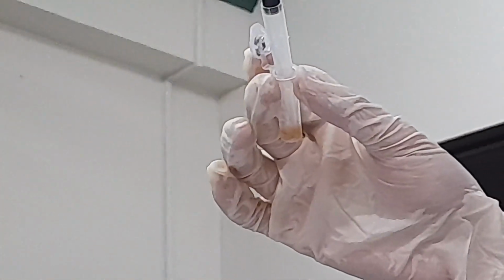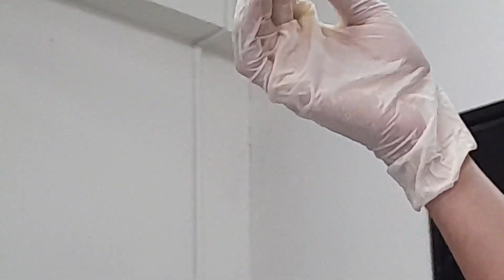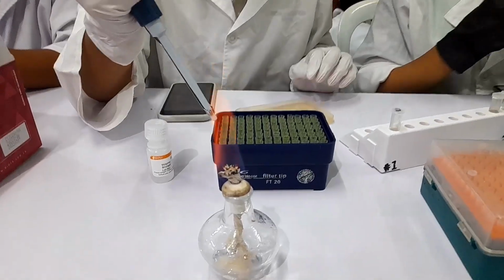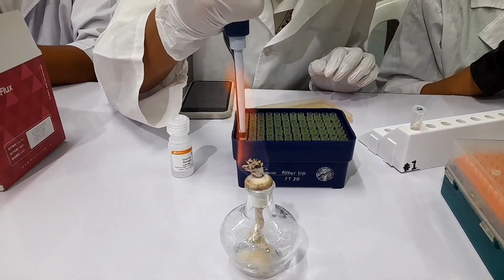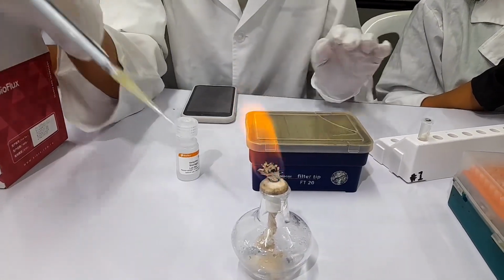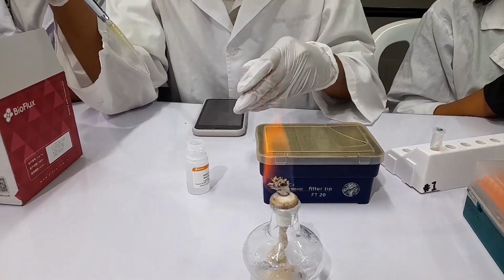You take a little more out, but just be very conservative. Okay. Yeah. It's okay. I would leave that there. Again, you don't have to take out all the liquid. Yeah, and then cover the thing. Try not to touch the inside of the lid because I saw you do this.